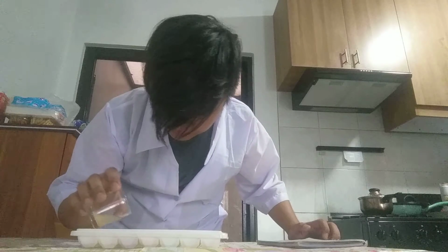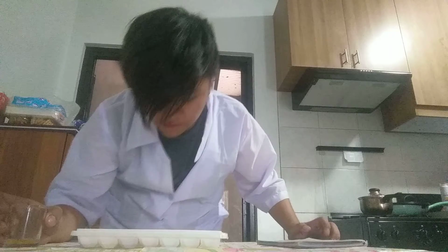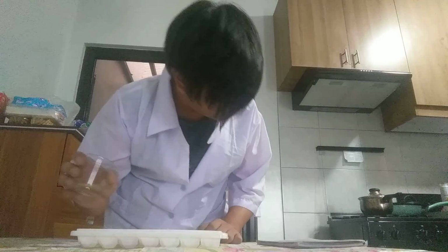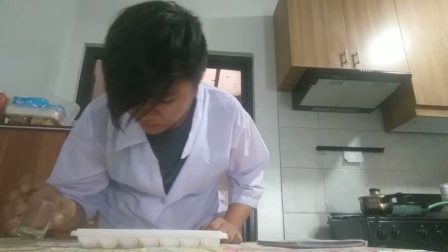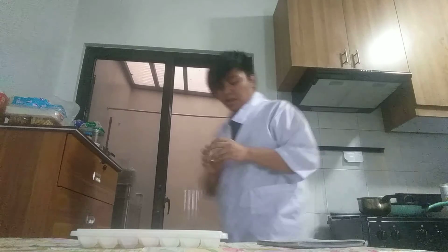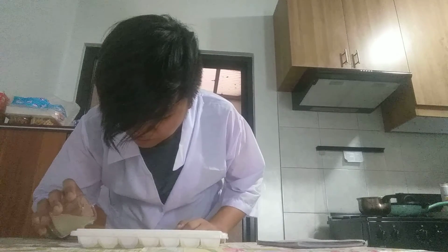Yeah, shampoo. So just like the baking powder, the shampoo is on the bottom and then the carrot juice is above that. Next up, detergent. Okay, so it did a bubbling effect. Hold on, I'm gonna add a bit more carrot juice because I ran out. Okay, so for the last one, we're gonna do the bleach.